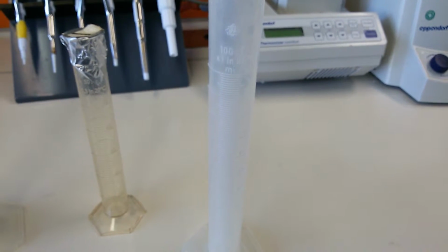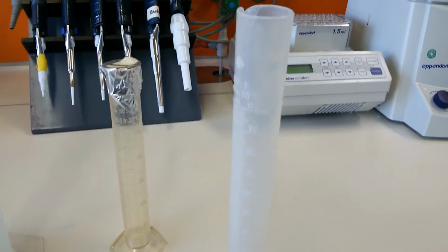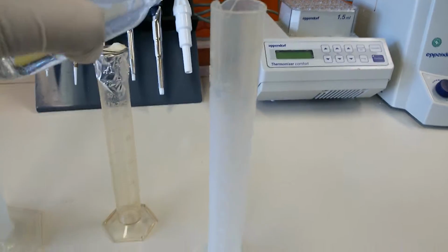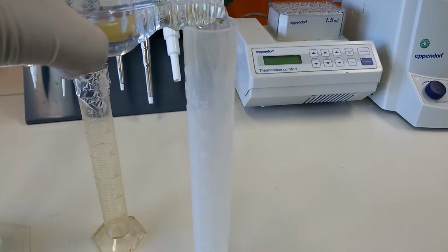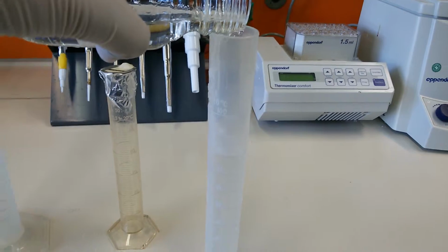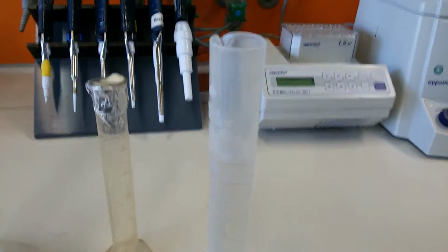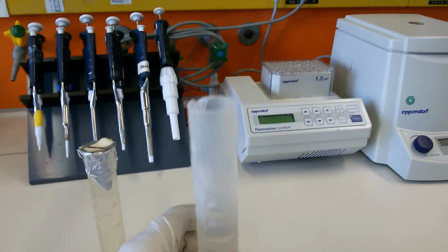We will take the example of our 100 ml measuring cylinder, and we will measure some volume. Right now I have some water in my hand, and I will show you in a very general way how we measure it. You can see it here. Now I'm filling it up. Let's say you just want to measure only 90 ml. So you fill it like this. Then you can look here.